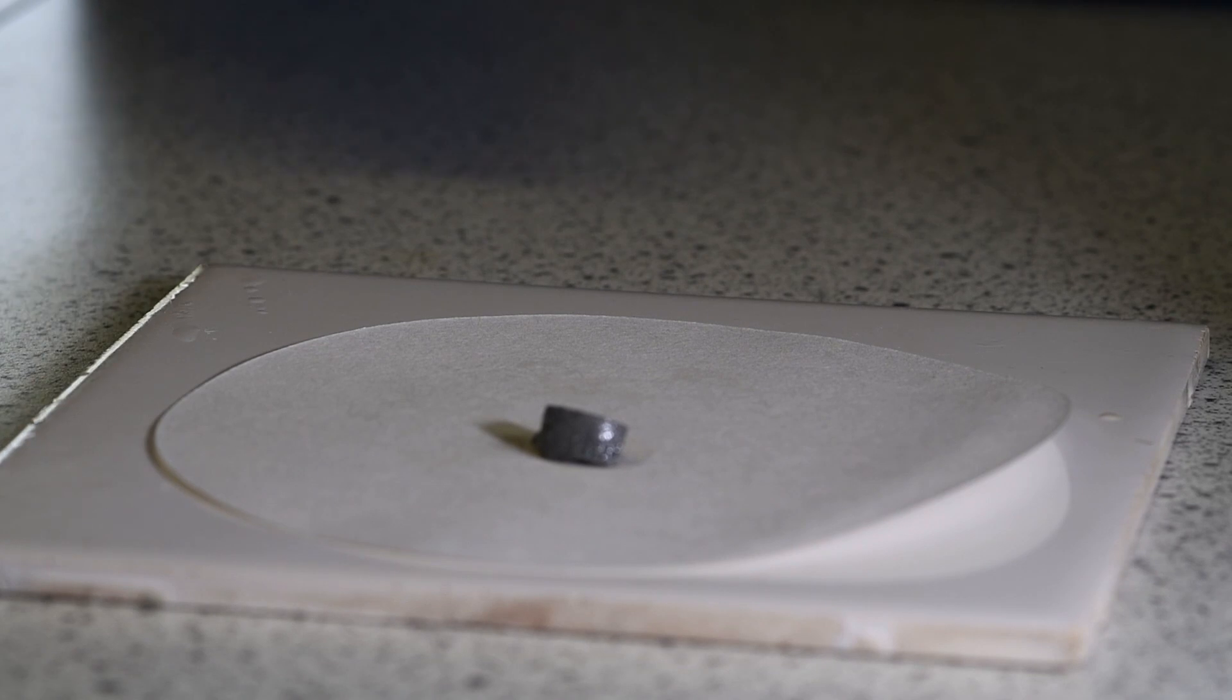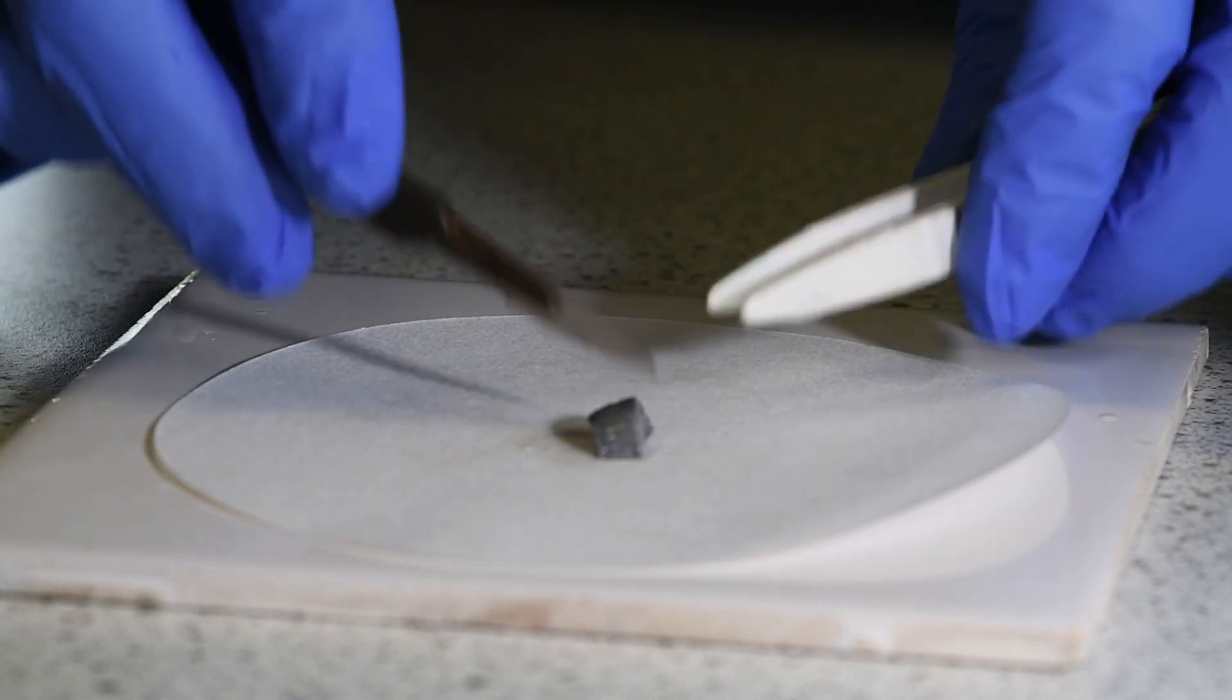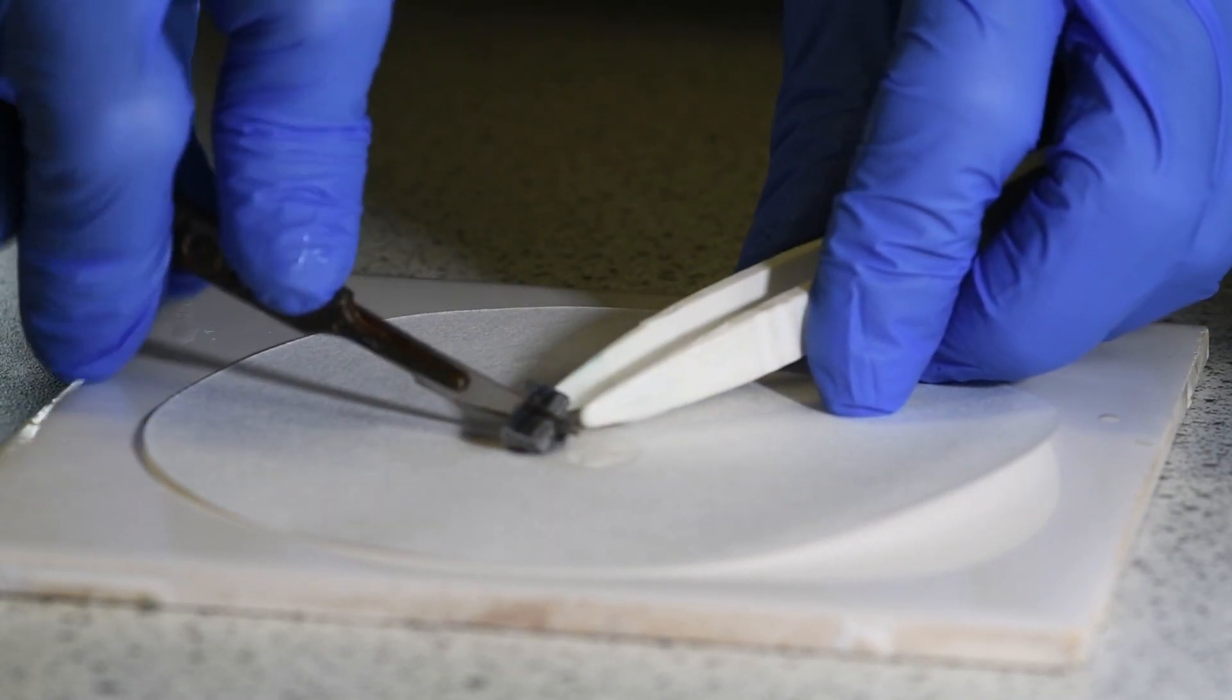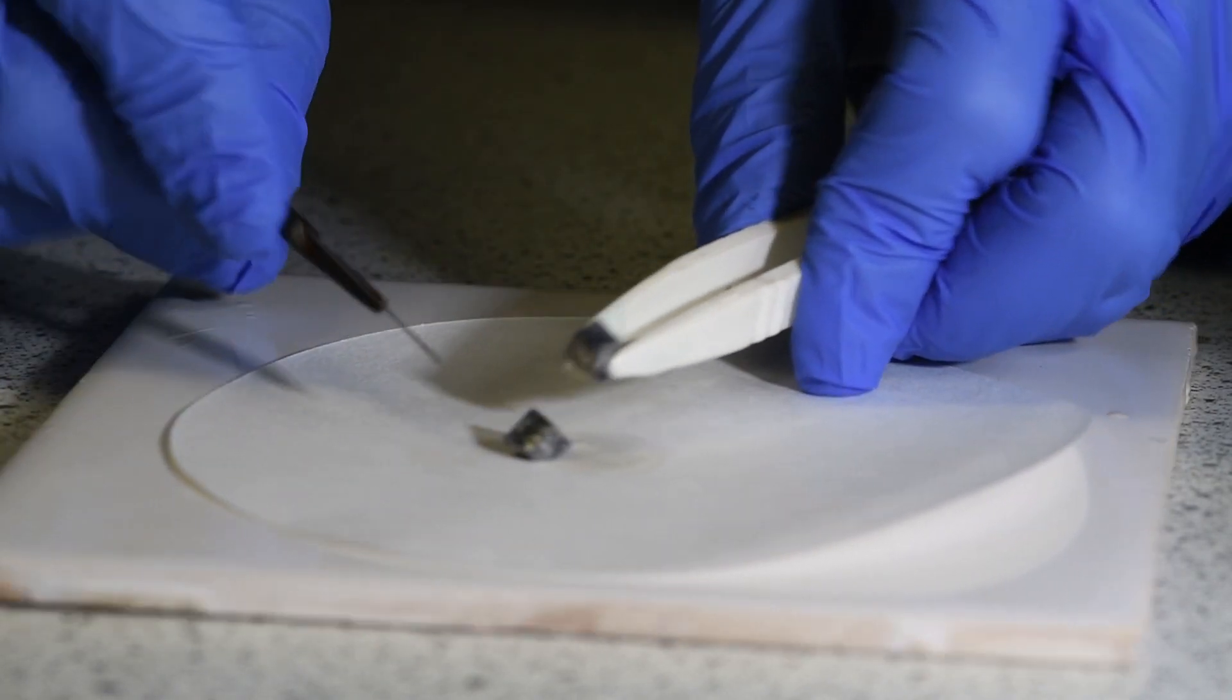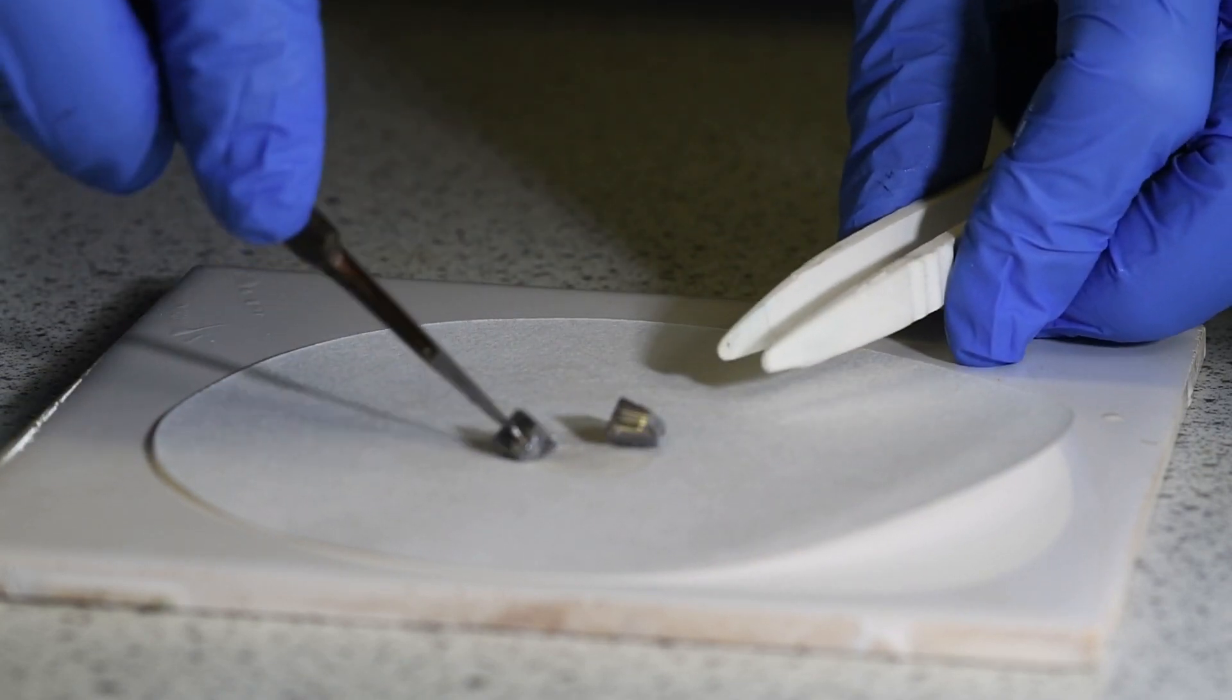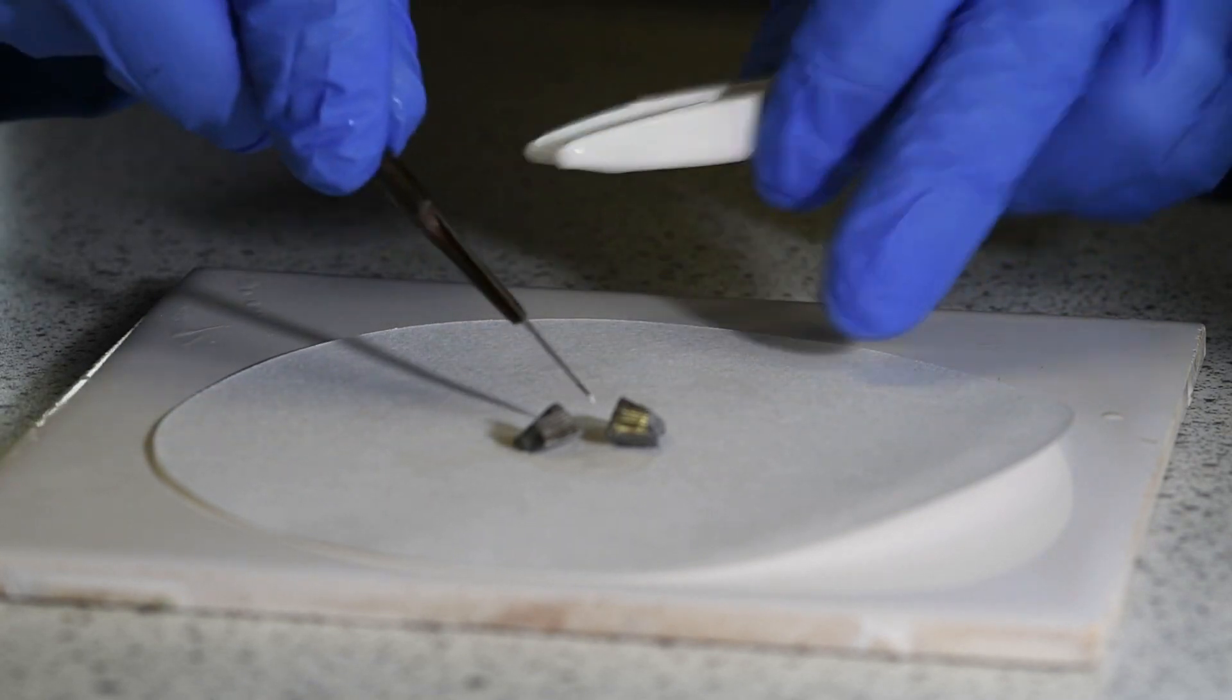You'll also see how soft that lithium is. If I cut, it's quite tough to cut. And hopefully you can see there that the surface of that lithium is really quite shiny.